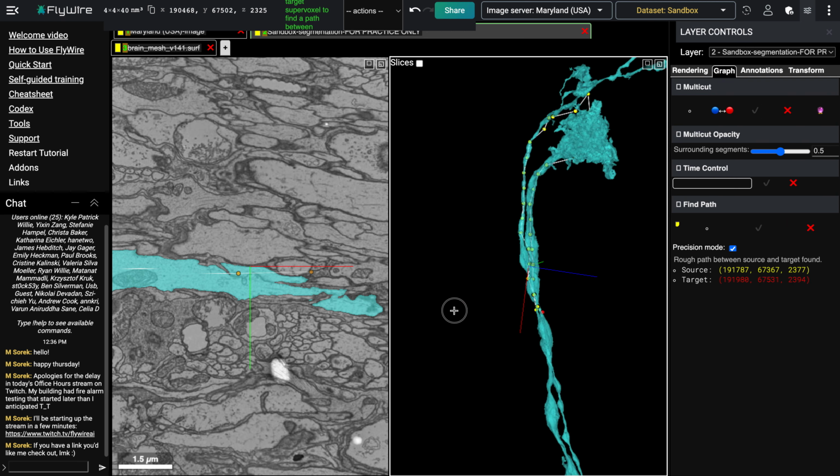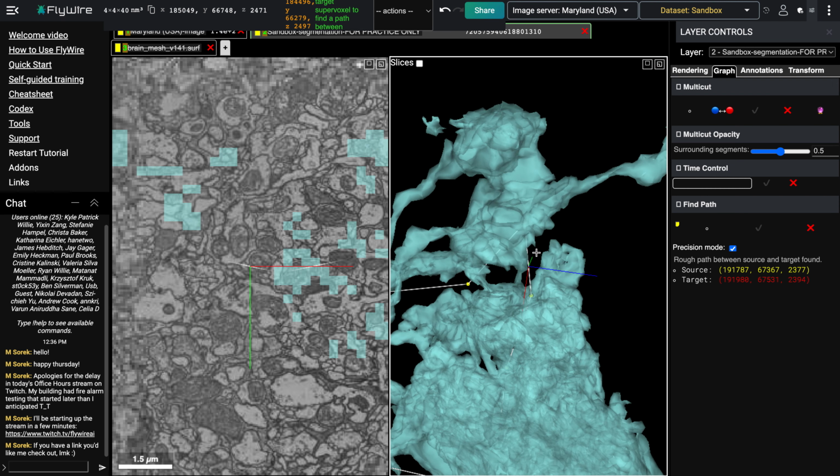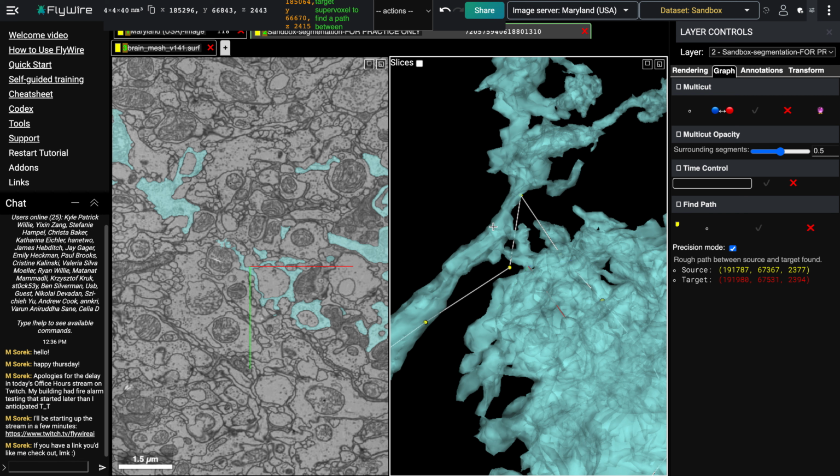Okay, so it looks like this is not the merger location, and instead the two neurons are being connected way up here. Okay, so I'm gonna go up here, and okay, we can see there's also a little bridge happening right here.